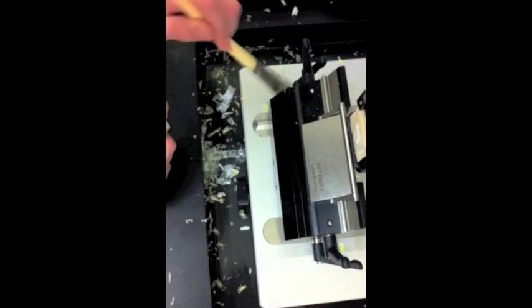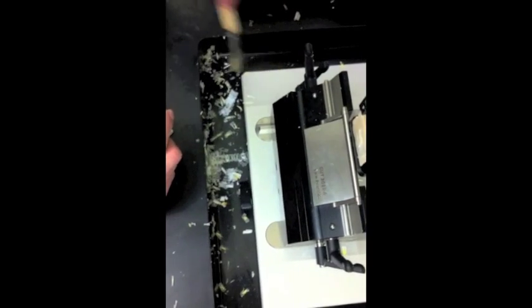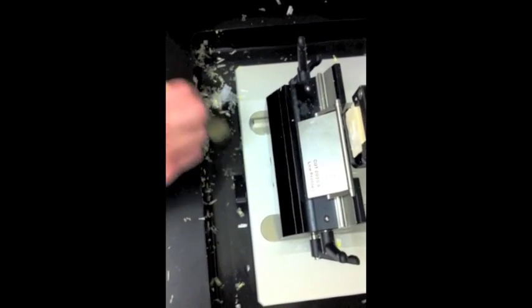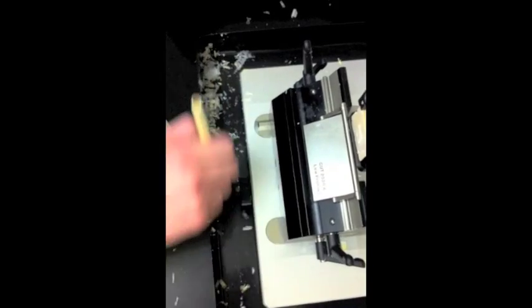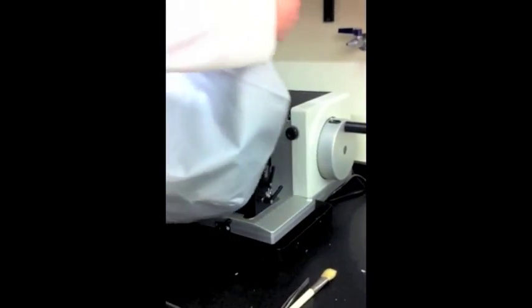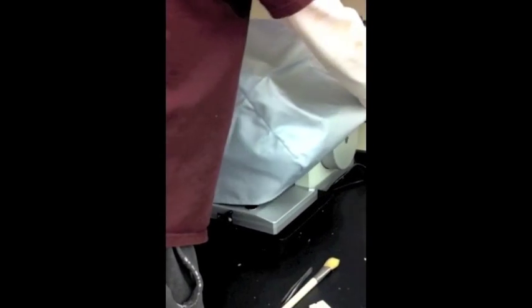Use a large paint brush to sweep away discarded sections and dispose of them. Cover the microtome when you are finished sectioning.